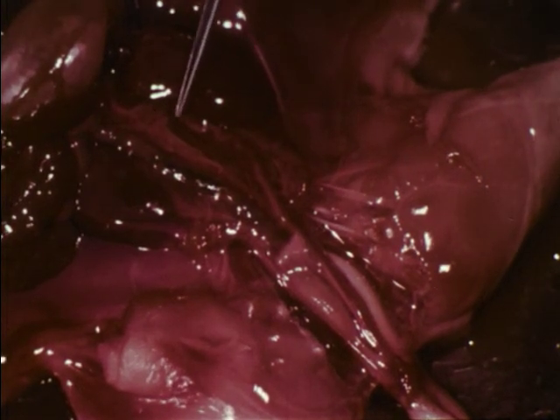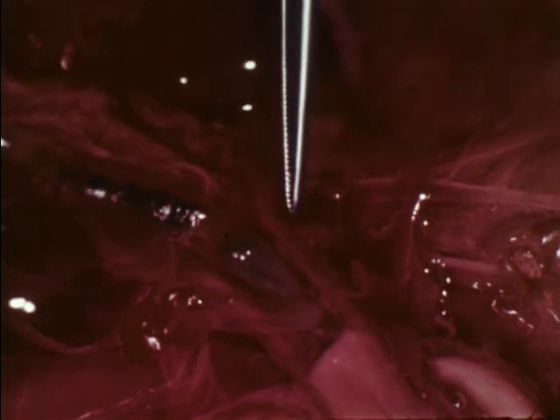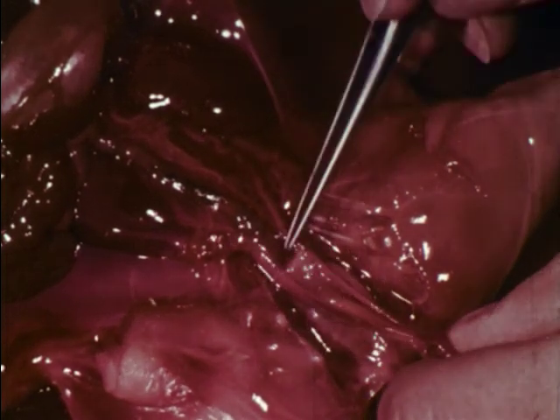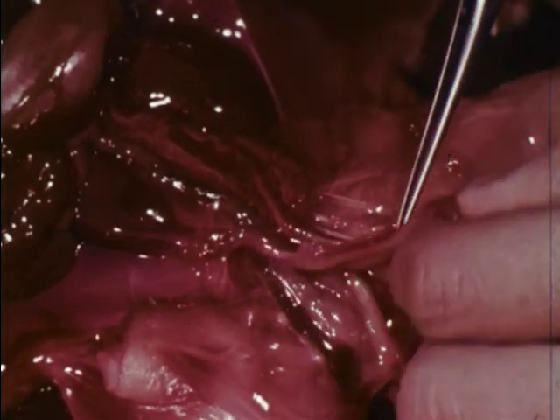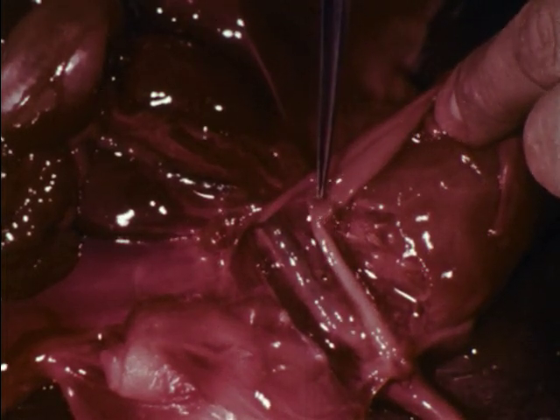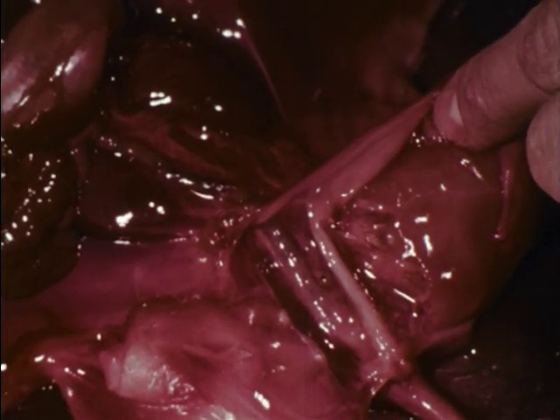Next, the excretory system will be examined. The two kidneys remove organic wastes, excess water and salts from the bloodstream, and excrete these waste materials as liquid urine through the ureters. The urine passes through the ureters to the urinary bladder. The bladder stores the urine until it is expelled through the single urethra.